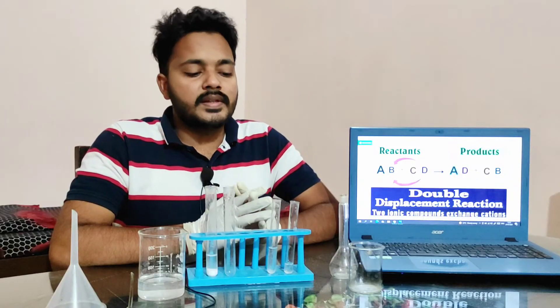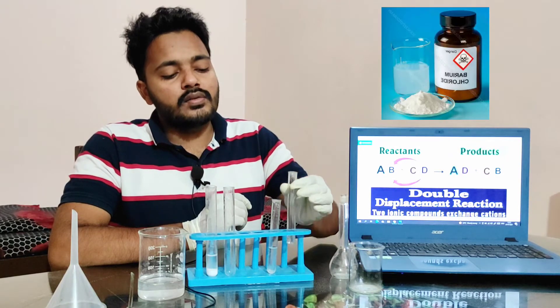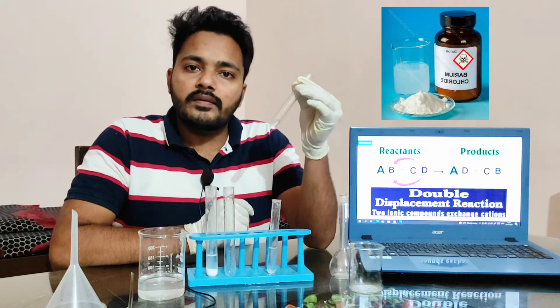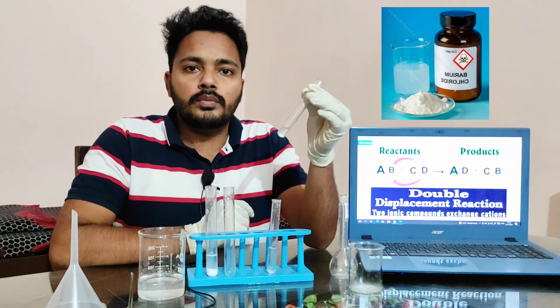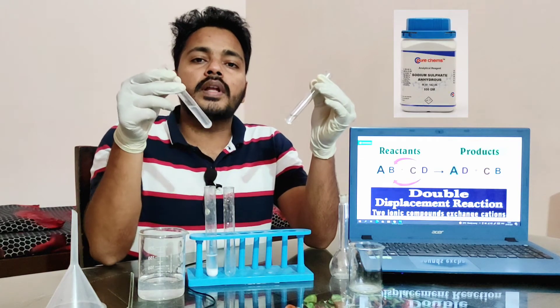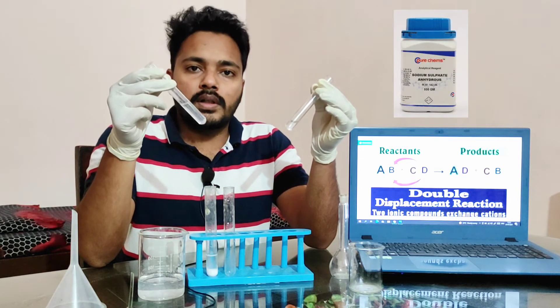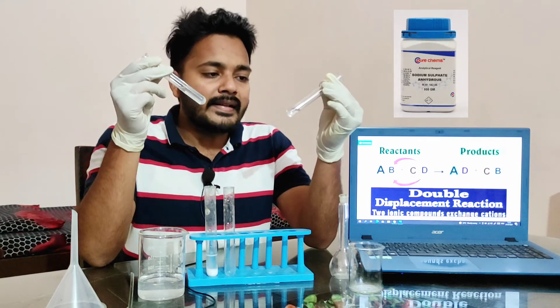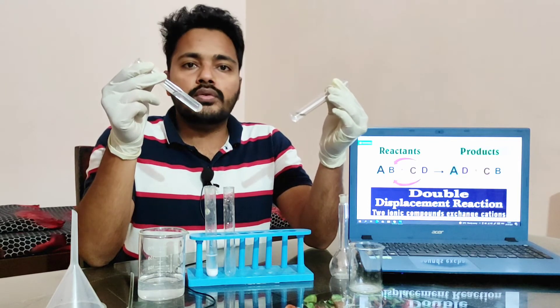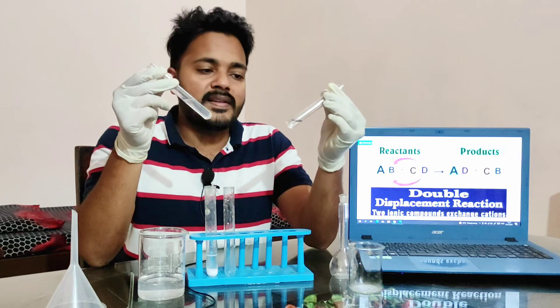In the procedure, initially you dissolve barium chloride in water in the first test tube. In another test tube, dissolve sodium sulfate in water. You can clearly see that both of these salt solutions are clear and transparent.